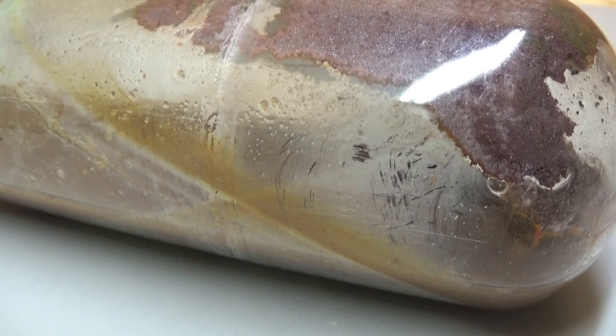Here you can see the produced copper on the wall of the reaction vessel, which tells you that the reaction is really working.